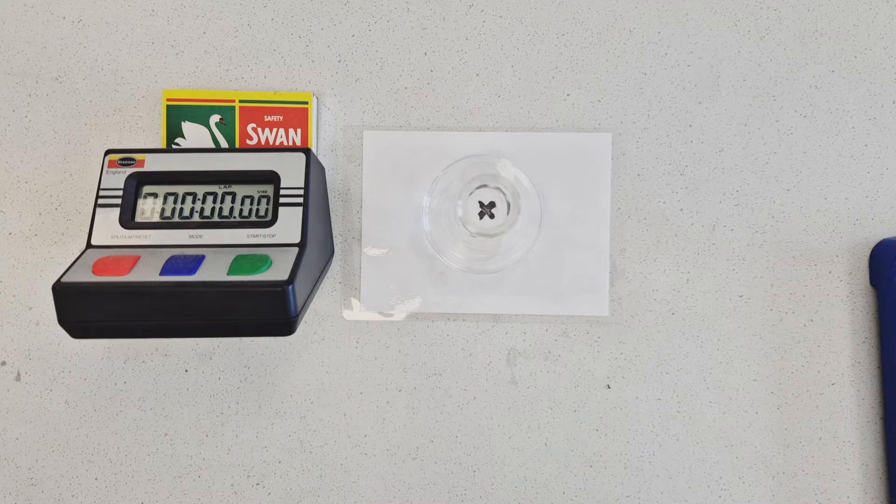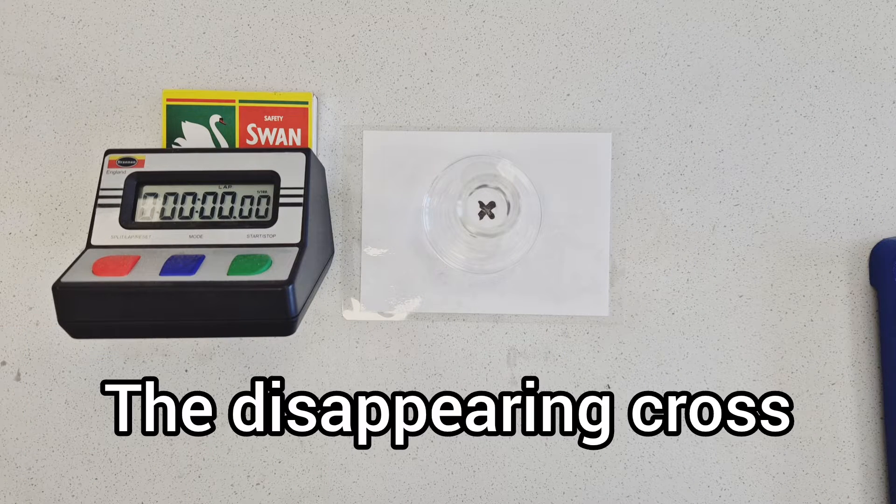Hi there, in this video we're going to explore a core rate of reaction experiment known as the disappearing cross.